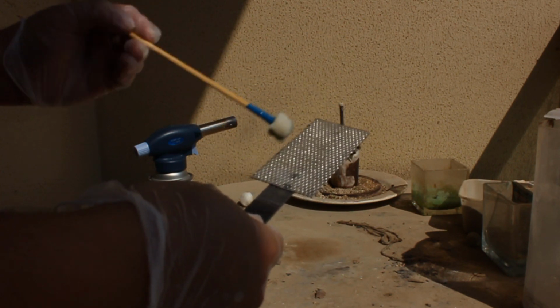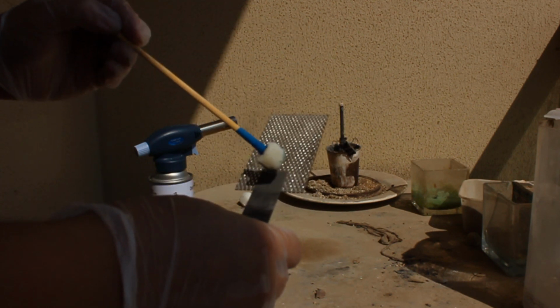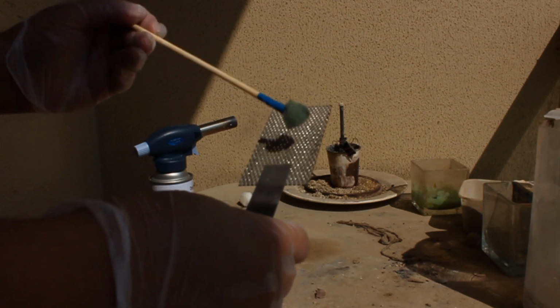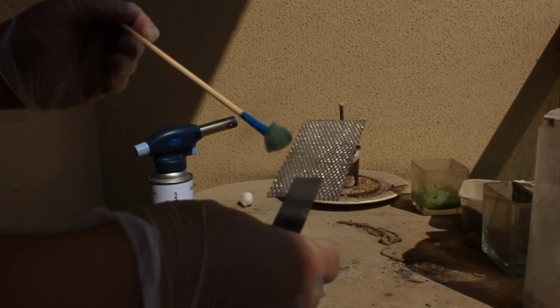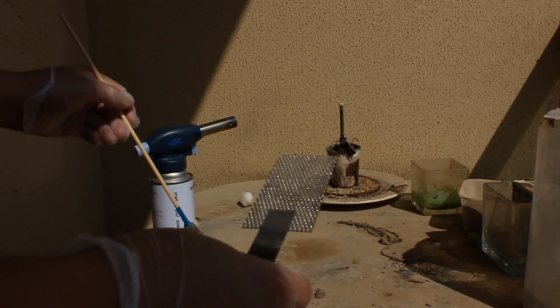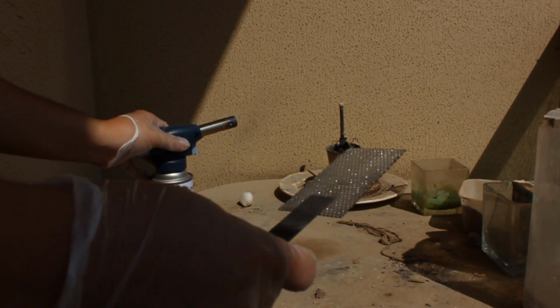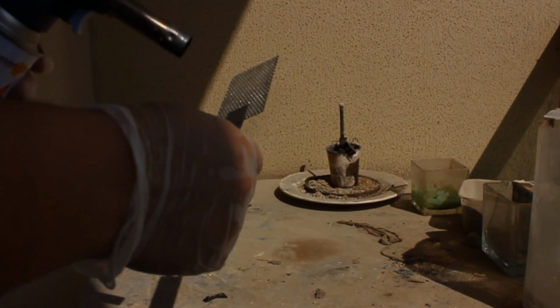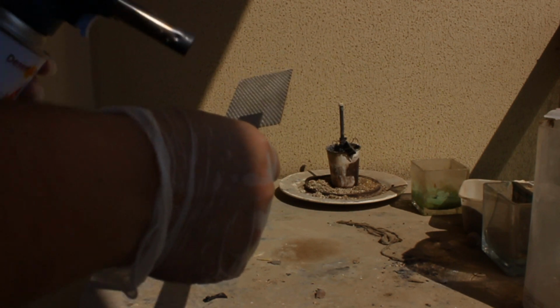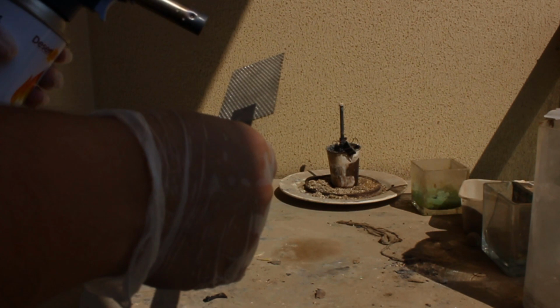Once you've done it for the 20th time, you're then going to bake this until the flame starts turning yellow and the metal turns red hot. That's when it actually converts. Once you see the yellow color, that's when it's ready. This is cerium doped, so the yellow color will tell us that you've got your cerium dioxide. So again, we bake this.